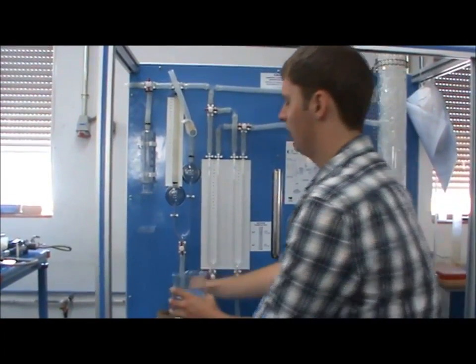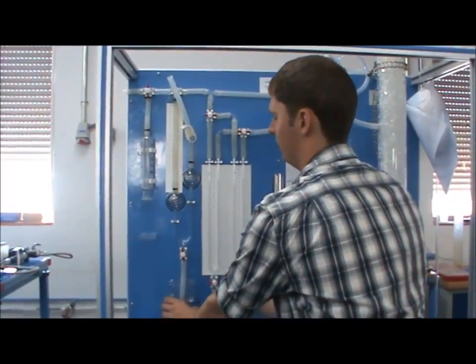First, fill the container with this KOH solution and place it here, like this.